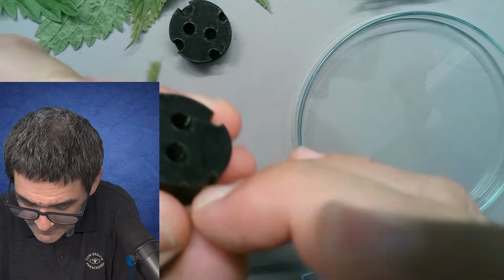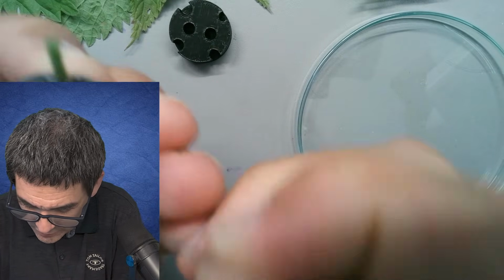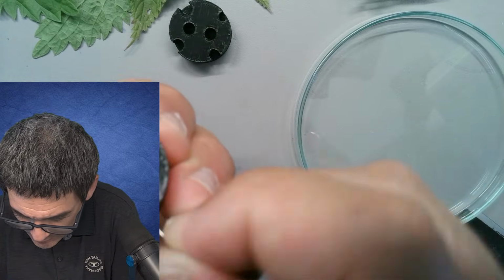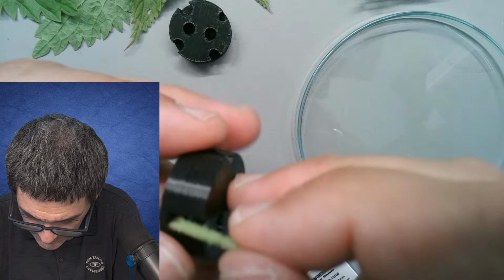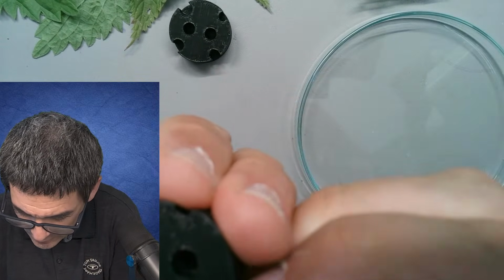I won't be able to fit it into the microtome. That's a bad thing here. So maybe I'm going to try to switch this over to the other one. It's a little bit larger. So let's try this here. Let's put this in here, push this all the way in.